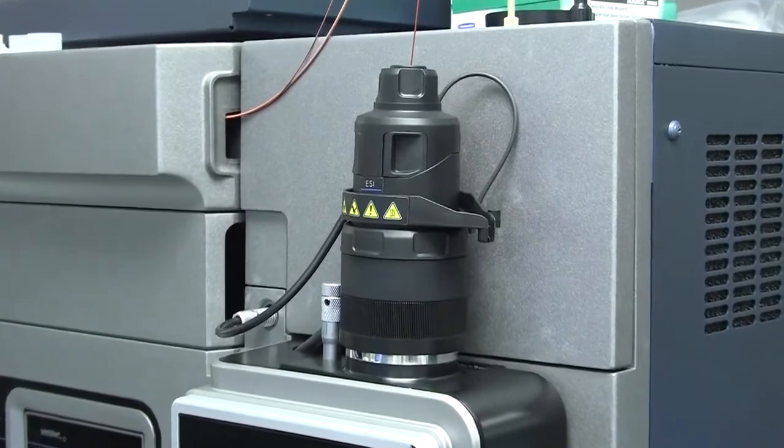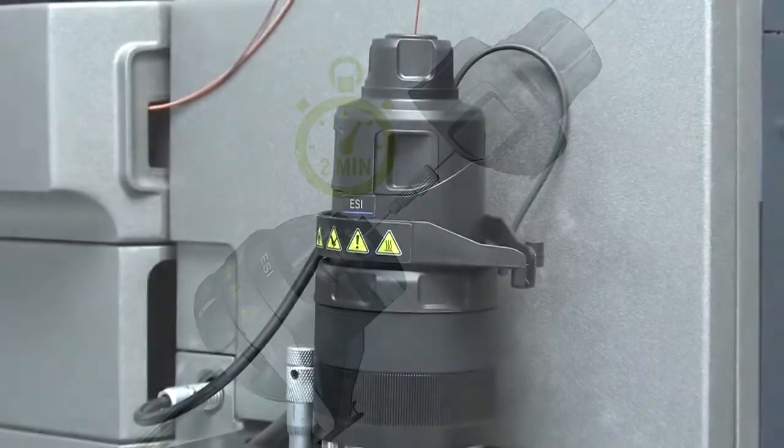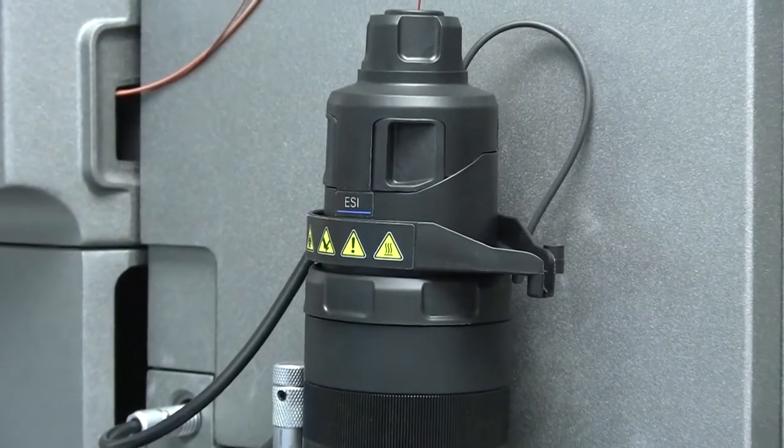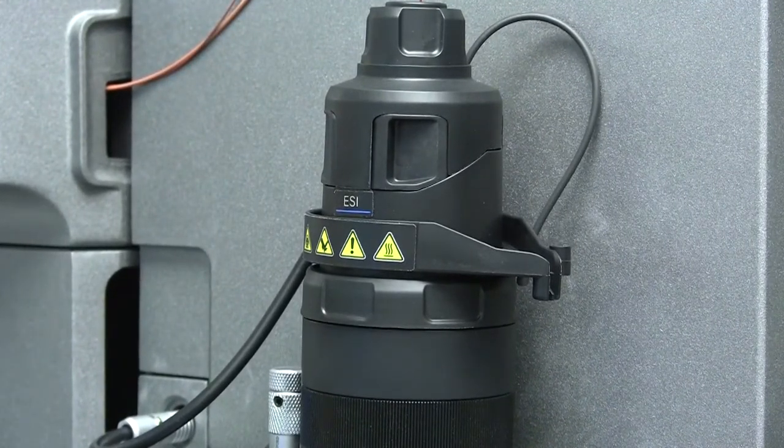This video describes how to successfully install the tool-free probe. The tool-free probe is compatible with a number of Waters mass spectrometers and is available in two varieties.